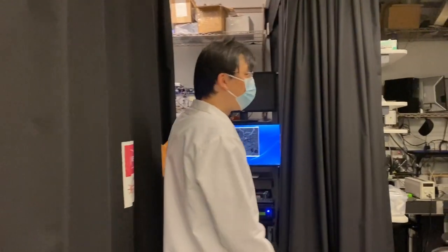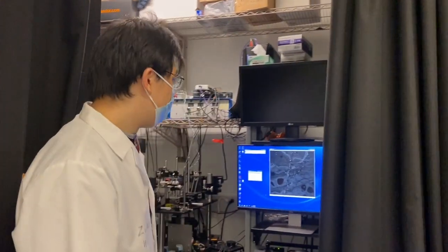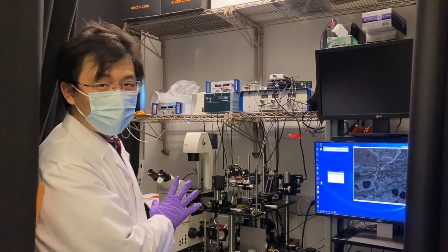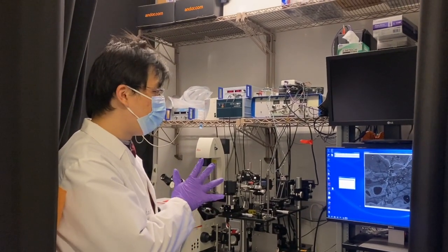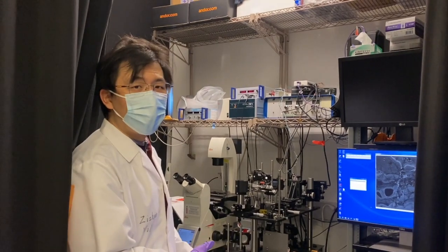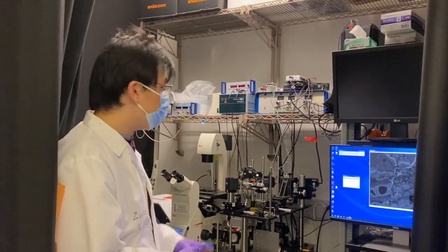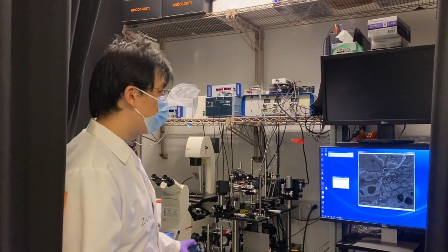There are many small booths in this room. This one is a more advanced version of our confocal microscope. It has a slightly different working principle that can give you a better scanning speed and a better signal-to-noise ratio. This is called a spinning disk confocal microscope.